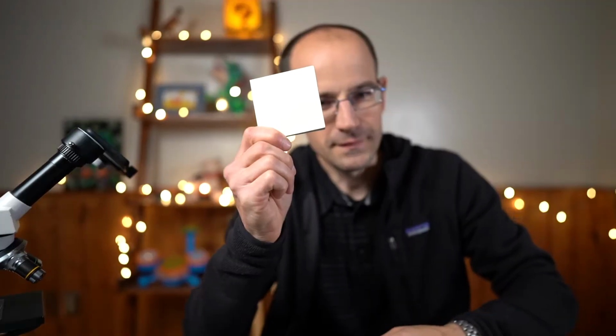shoot, I gotta look it up, hang tight. Got it. So this is what the king cannot eat. The king cannot eat starch. So we have to check our foods for starch so the king doesn't eat those because it will kill him instantly. And then the queen cannot eat sugar and fats mixed together. So we have to test for those. We'll see what foods they're allowed to eat, and then we can serve those foods to the king and queen.